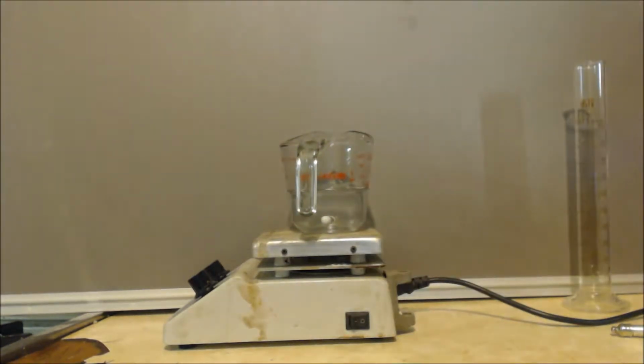about 30 grams of anhydrous copper sulfate. The reason I use 30 grams of copper sulfate was because it's a pentahydrate, which means it can hold 5 hydrates. I figured there might be about maybe 12 milliliters of water in that alcohol. That's less than a mole of water, because a mole would be 18 milliliters. So I wanted to put something in there that would at least absorb a mole. I wanted to do overkill, you know what I mean?